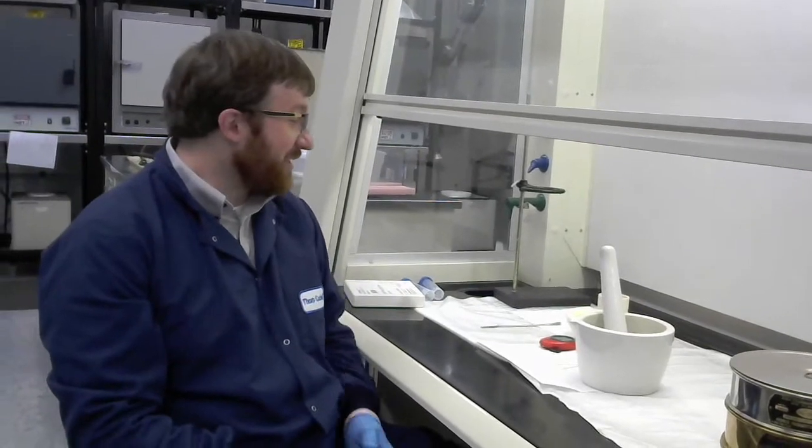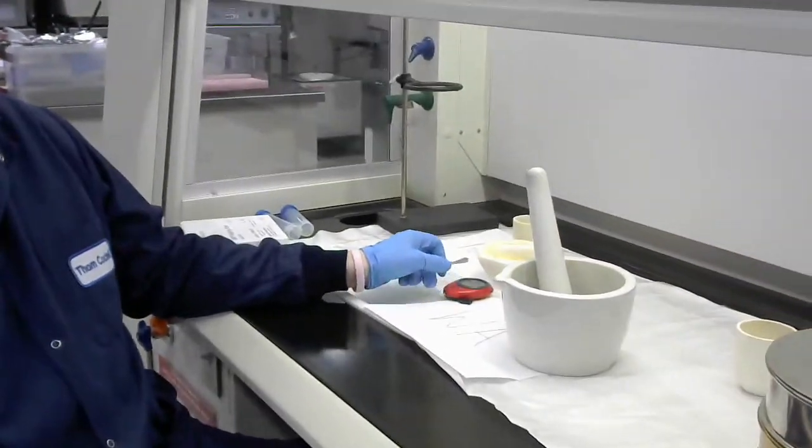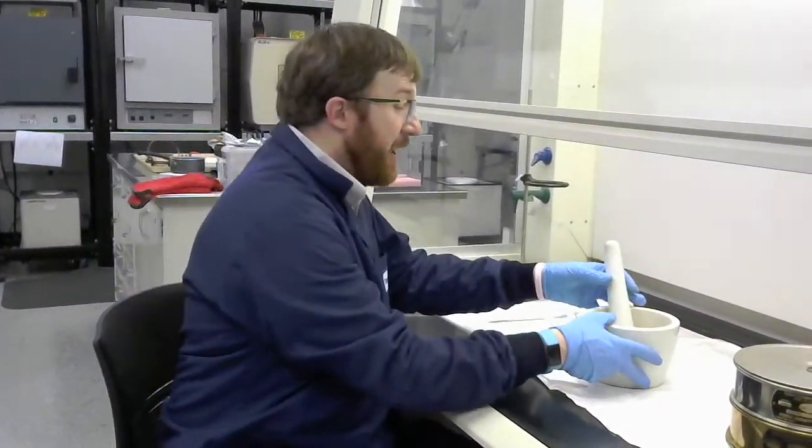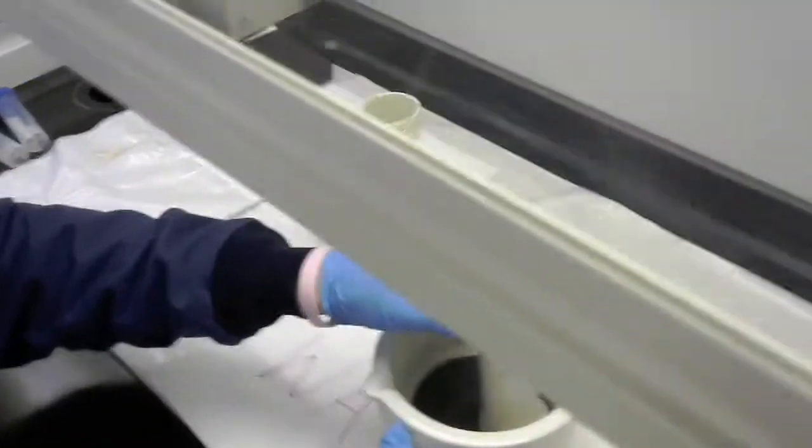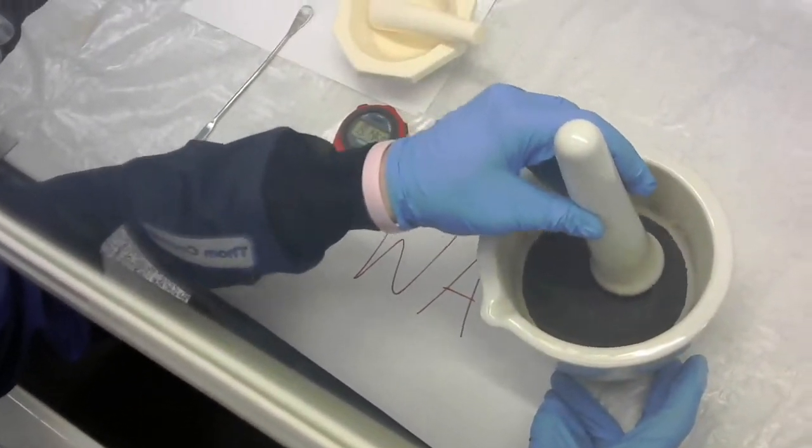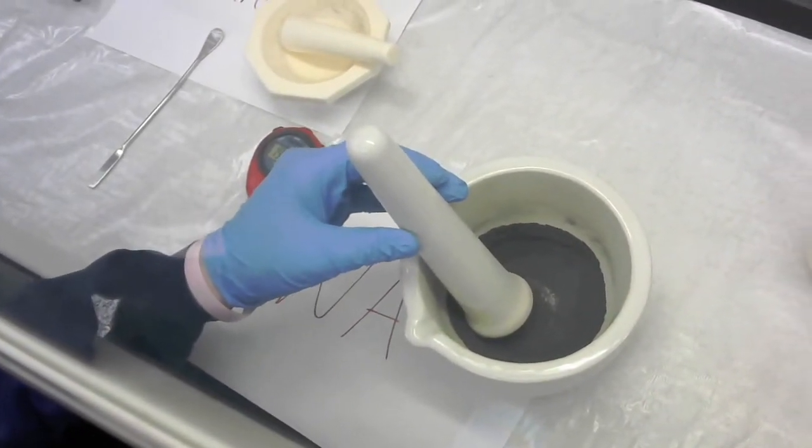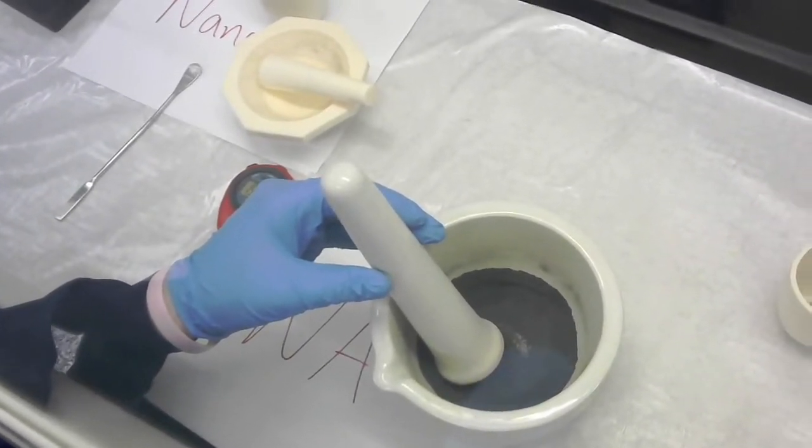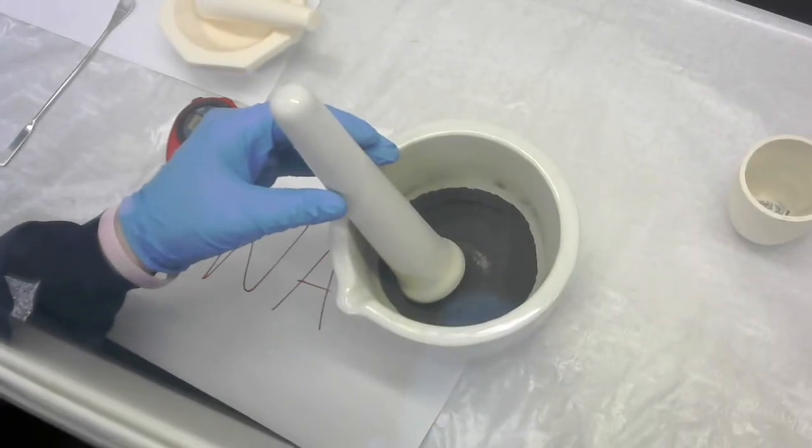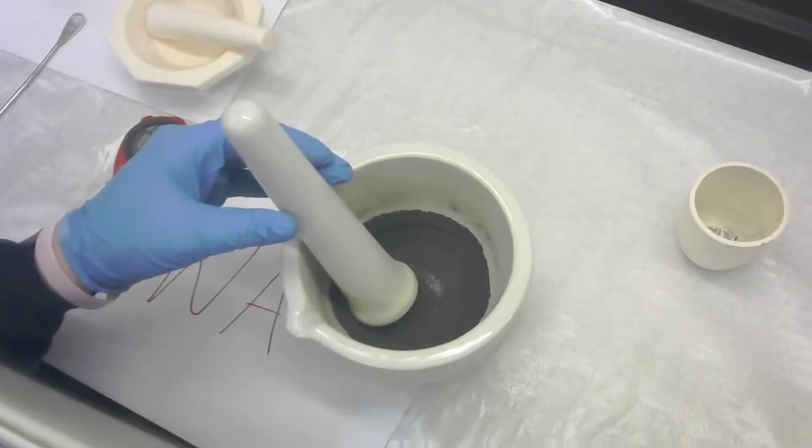Alright we are back. Me and Antonio have been milling for the last 15 minutes or so. The stopwatch is some malfunction there but you can kind of see that we've been going for about 15 to 20 minutes here. And the powder that you have is in a whole different state if you want to get a view of this. So a couple things to again note and I know that there's going to be some difficulty seeing this on the camera but note any changes in the appearance. So color, also obviously the sort of the nature of the powder. Is it small? Is it large? Is there big chunks? Stuff like that.